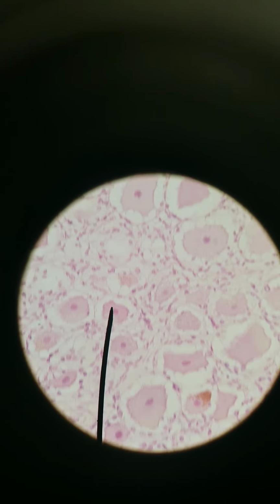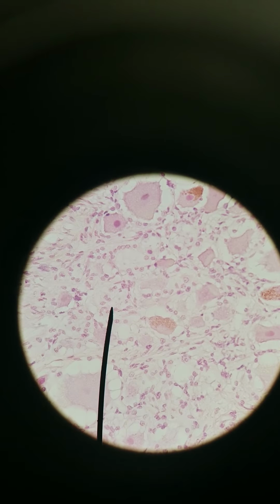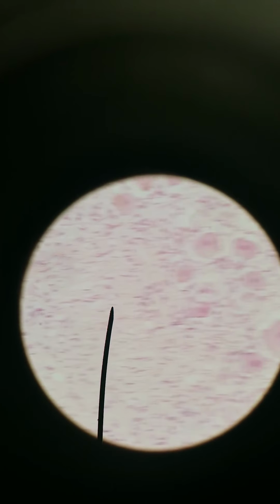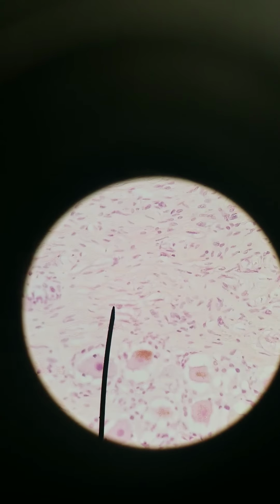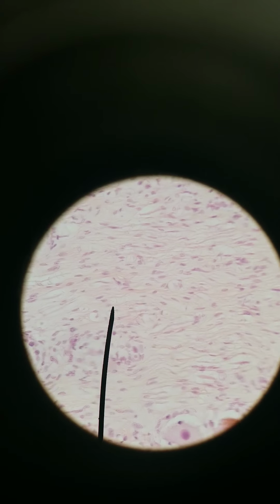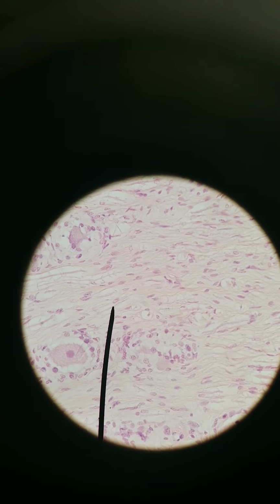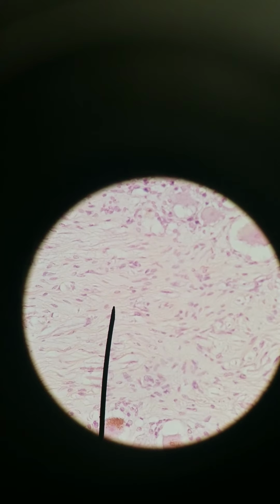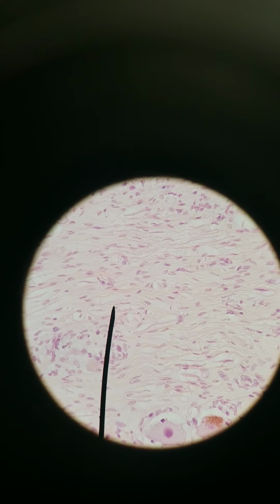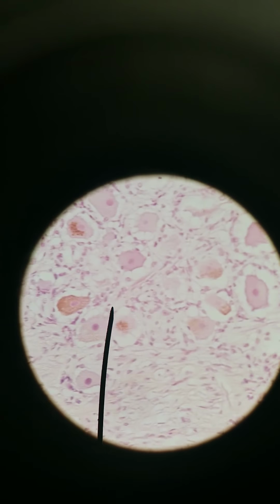You don't really see the axons, because the axons are off to the side. At least you don't see them right next to the cell body. You have to imagine this in 3 dimensions. All of this waviness that you see, like left and right waviness in this image, those are the axons. There are cell bodies of satellite cells, or not satellite cells, Schwann cells. But those are axons that are off to the side. So basically, the cell body is off to the side while the axon is on another side.